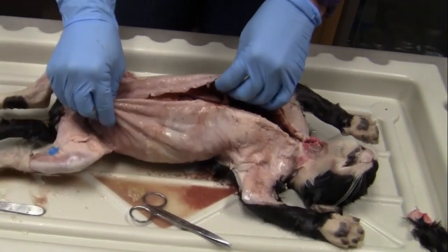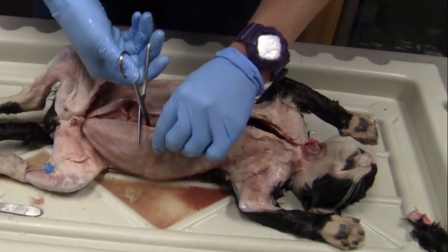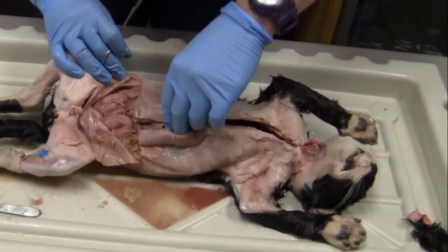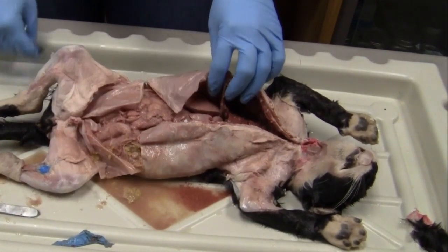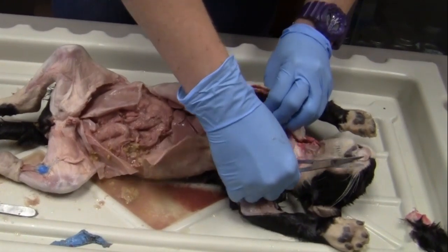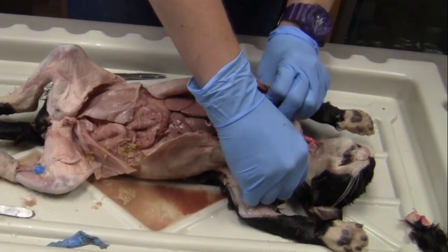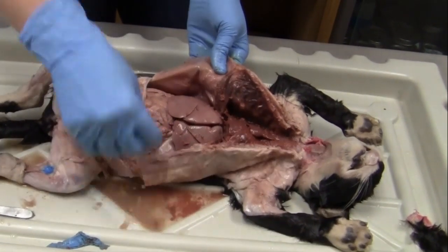Okay. And then what I want you to do is we want to save this abdominal cavity, but in order to open up these cats, we're going to cut just little flaps here on the side so that you can open up this cavity a little better. Okay, there we go. And it looks like a good chunk of dye there. You also are going to want to cut the diaphragm a little bit so that you can actually open up the cat. And a lot of today is going to be cleaning up some of this good stuff that's in your cats. Get that opened up pretty good. There you go. Now you guys are able to see the whole abdominal cavity and the thoracic cavity.